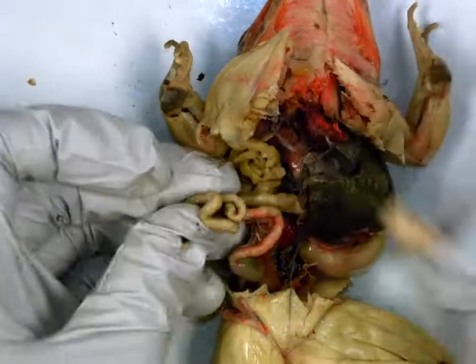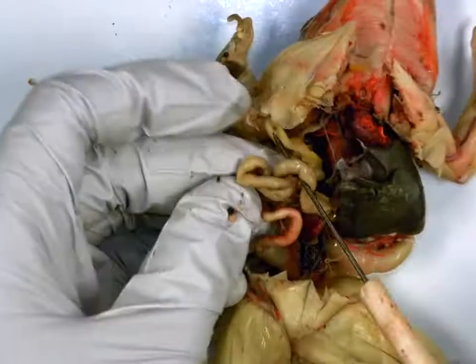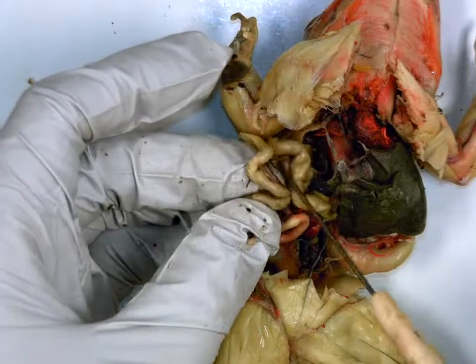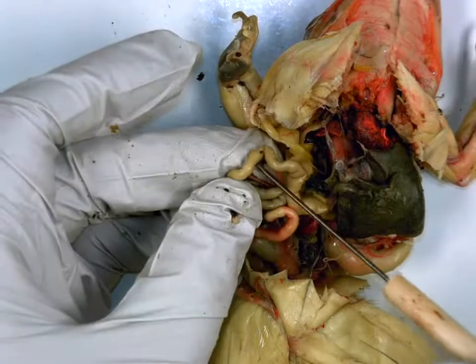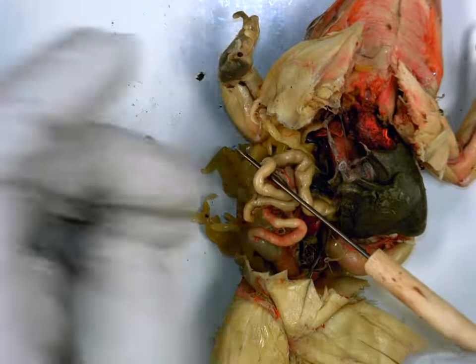All right, if we go further, what do I call this thin coiled up tube here? So, small intestine is duodenum, which just means top portion. Duodenum. Function of your intestine? Absorbs nutrients and further digestion. Further digestion and absorbs nutrients.